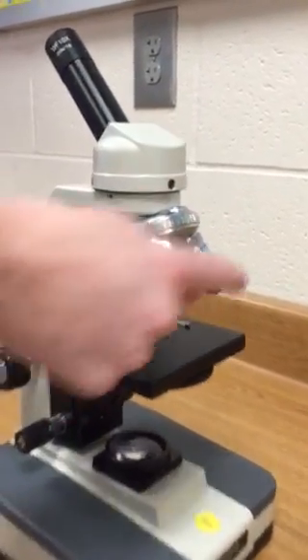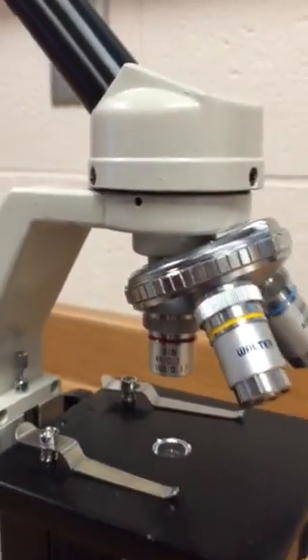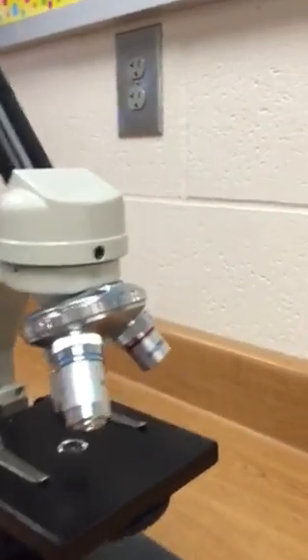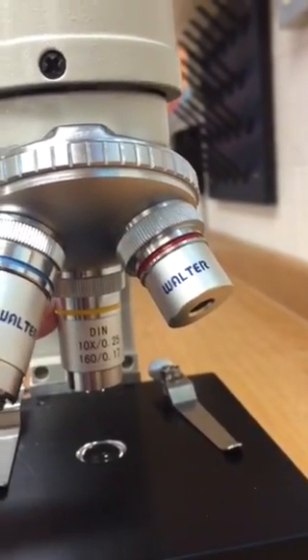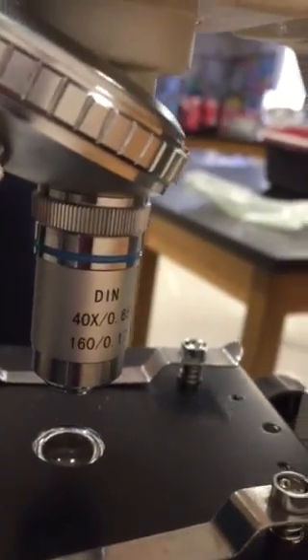Here we have the objectives. We have the lowest power objective, which is the red objective — a four times objective. If I twist it into place and hear it lock, we have the medium power objective, the yellow objective, which magnifies ten times. Then if I click one more time we have the high power objective, and that one is forty times.